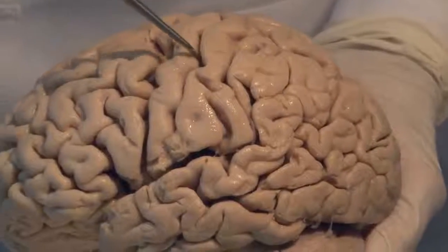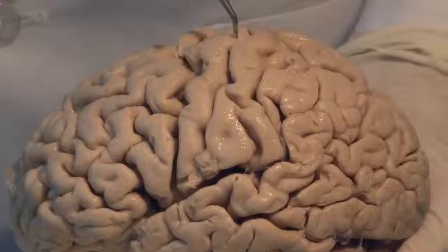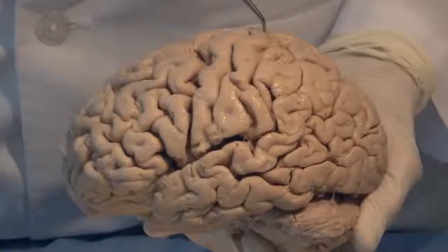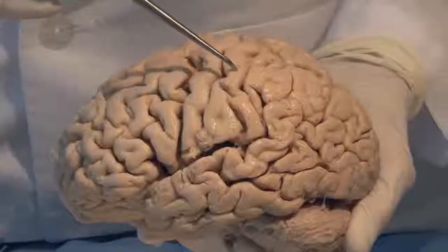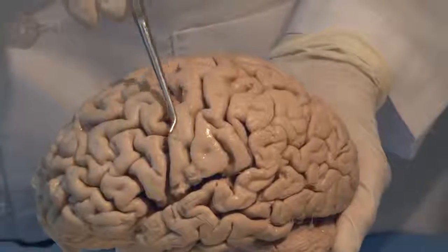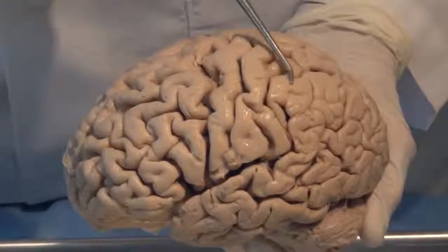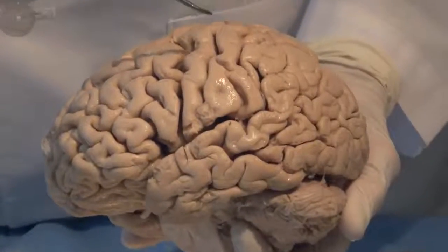behind it. And very interestingly, the cortex involved in voluntary movement is in front of the central sulcus, and the cortex involved with primary somatic sensation from your body is the gyrus behind the central sulcus. So this is frontal lobe, this is parietal lobe, this is motor cortex in general, and this is sensory cortex in general. So we're just getting our bearings.